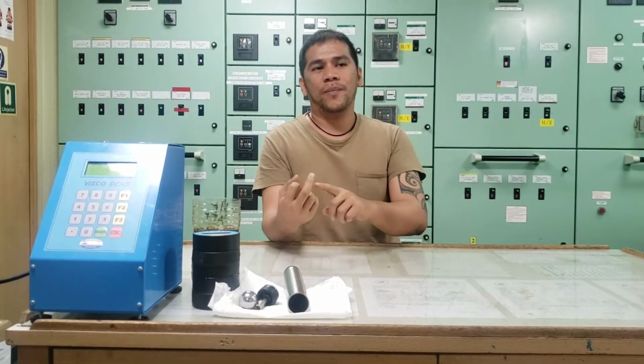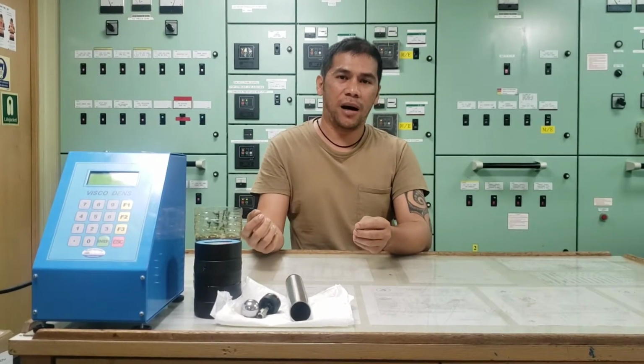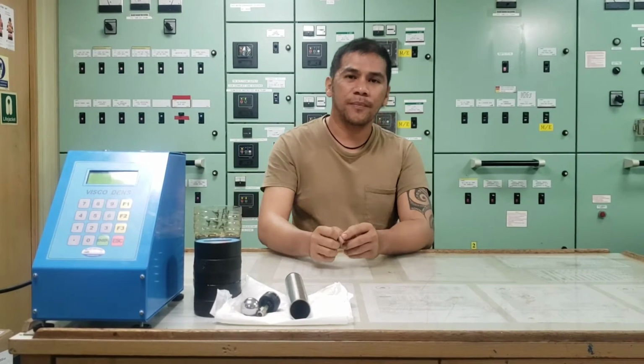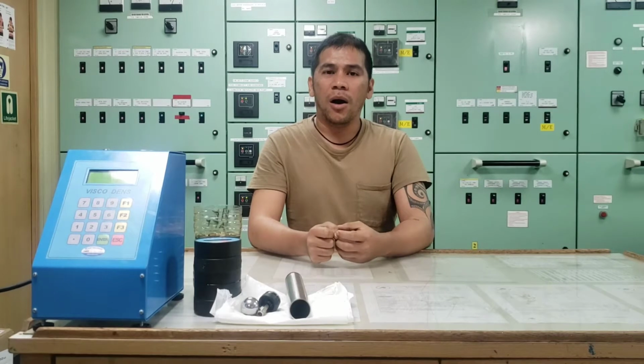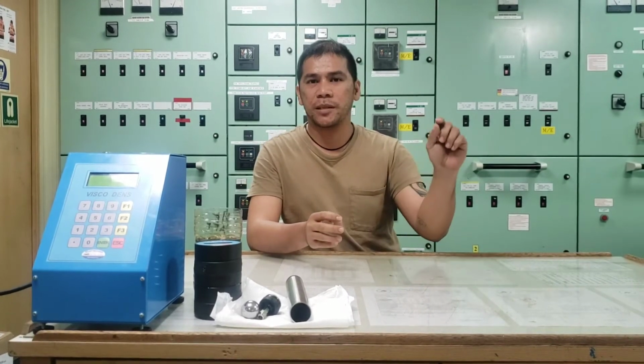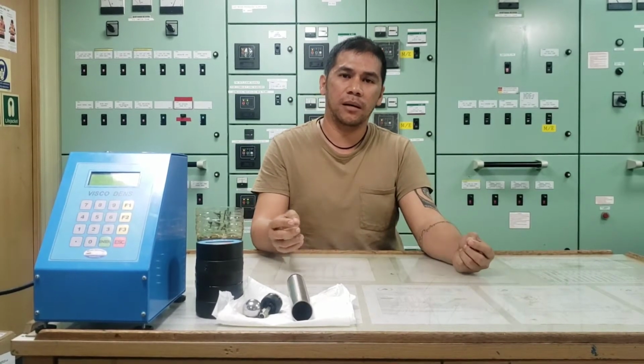From last week, we discussed how to take ferrous content analysis, the water in oil analysis, including water analysis for the cooling water. And today, we are going to discuss how to determine the viscosity of our lube oil by the use of the Viscodense. So you know already what a viscosity is. So how could we determine the viscosity drops or the viscosity increase in our lube oil?